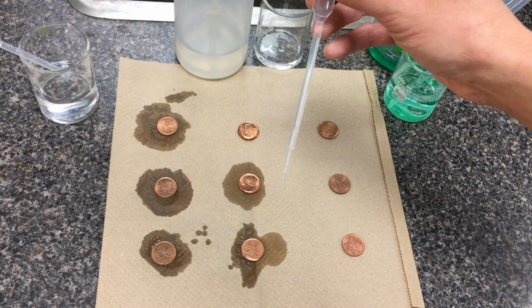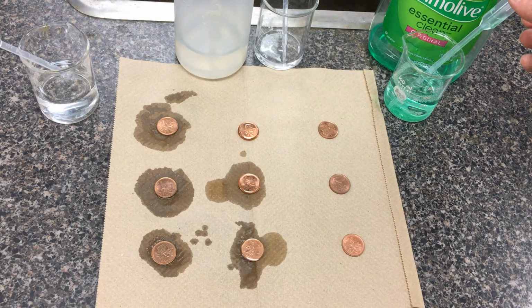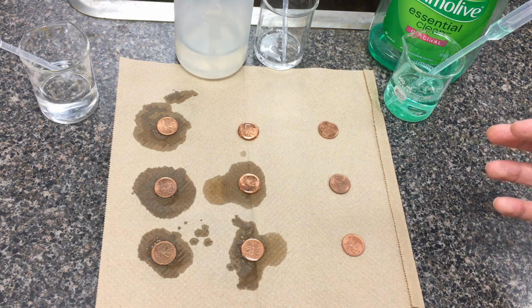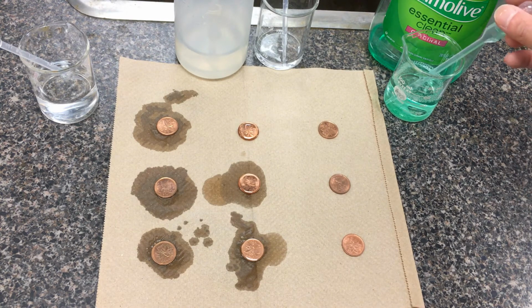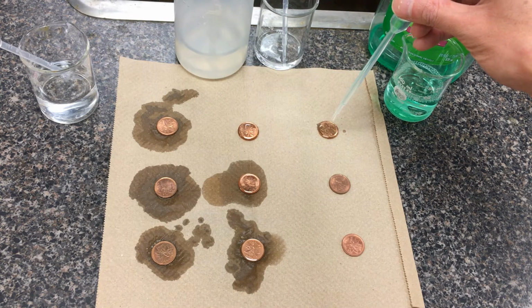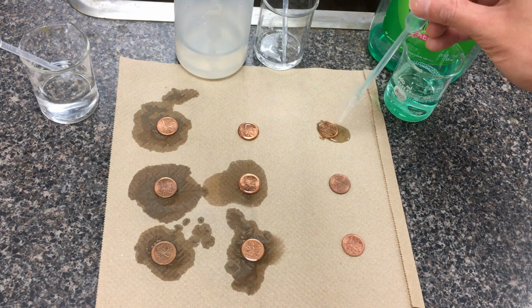Maybe the intermolecular forces are not as strong as, say, in a water solution. For a soap water solution, although soap has a really complicated chemical structure, do remember that there was a lot of water here before I added the soap, so we're just trying to ask ourselves how does soap interfere with the water molecules. It comes in between the waters, affecting the surface tension, the intermolecular force. So soap water: 1, 2, 3, ... 17, 18, 19, maybe about 19 there.